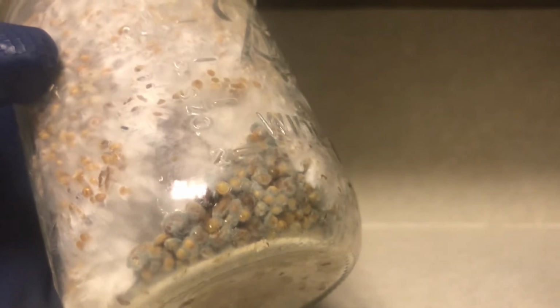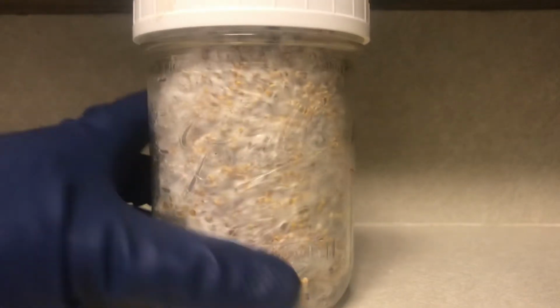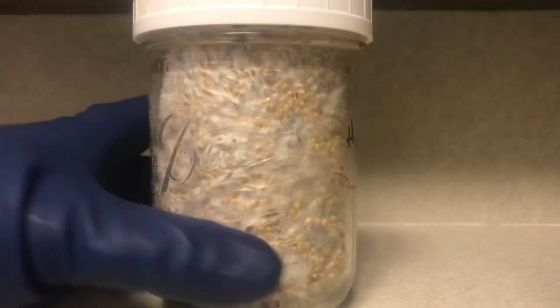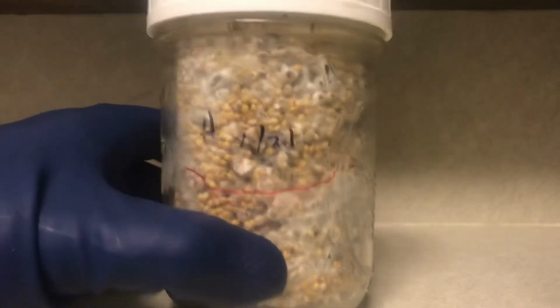And this ruins this whole jar. This jar needs to be tossed outside completely. It doesn't matter how much of this is good. You can't salvage any part of it. Or at least you shouldn't, unless you want to do more work and then have to throw it away later.